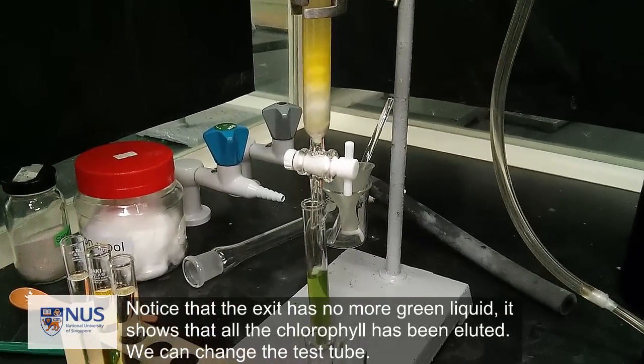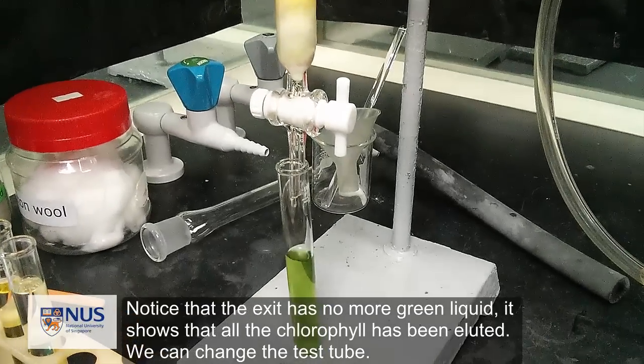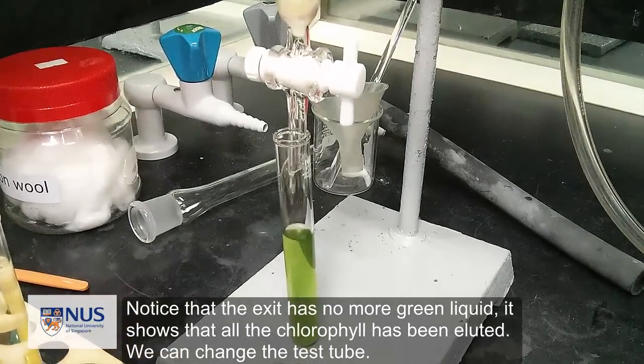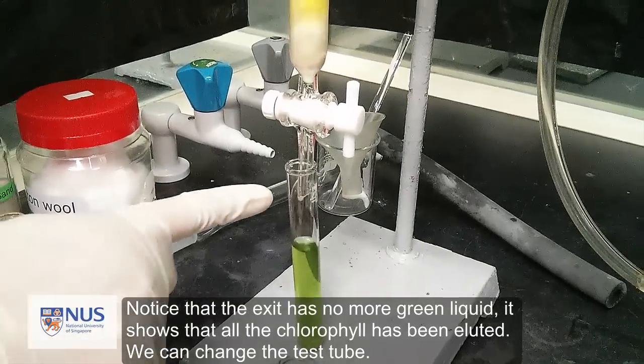Notice that the exit has no more green liquid. It shows that all the chlorophyll has been eluted. We can change the test tube.